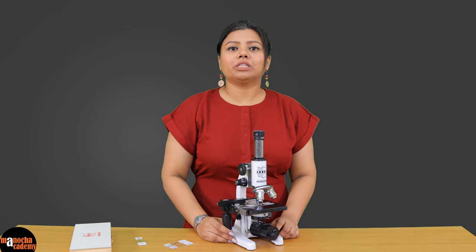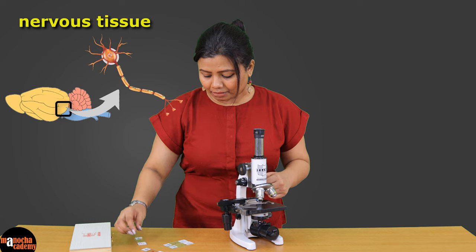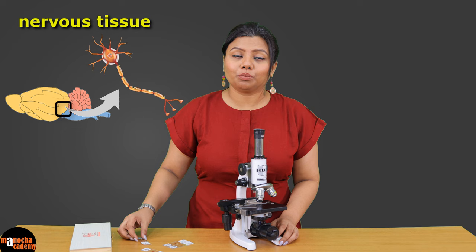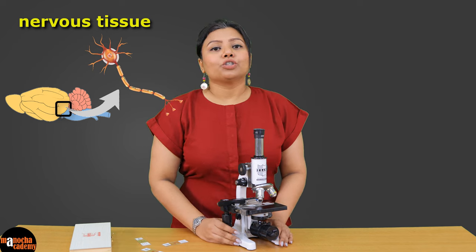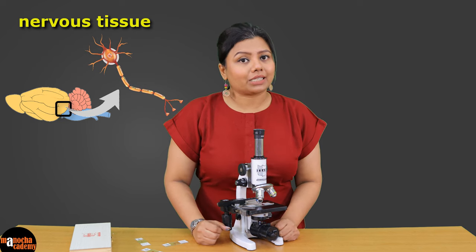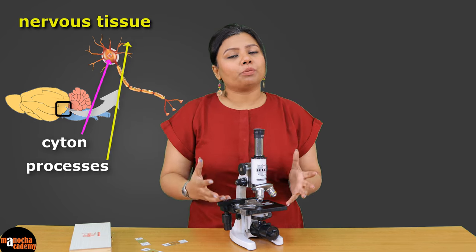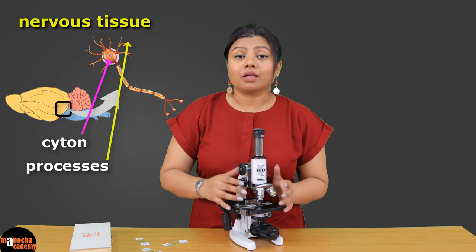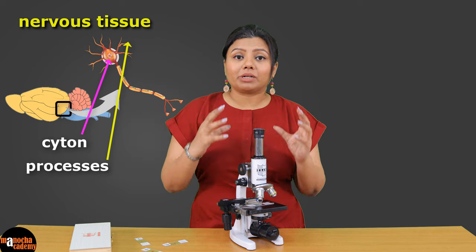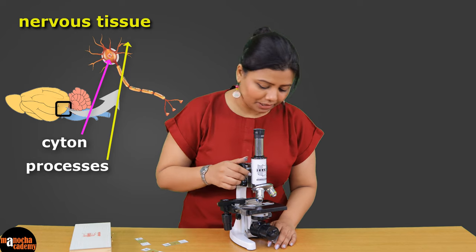Now we move on to the nervous tissue. We are going to observe a section of the brain of an animal to see how nerve cells look in a cross section. Nerve cells in all animals have a cellular body known as the cytone, which contains the nucleus and gives out processes. When you observe nervous tissue under the microscope, the main thing you will see are these processes coming out from a cellular structure, and that is how you identify a nerve cell.